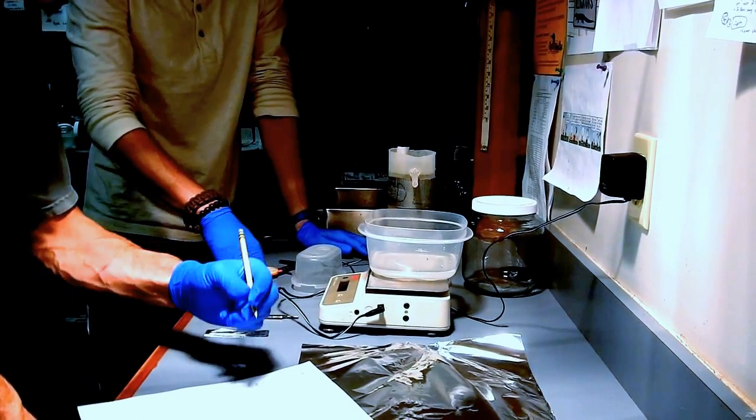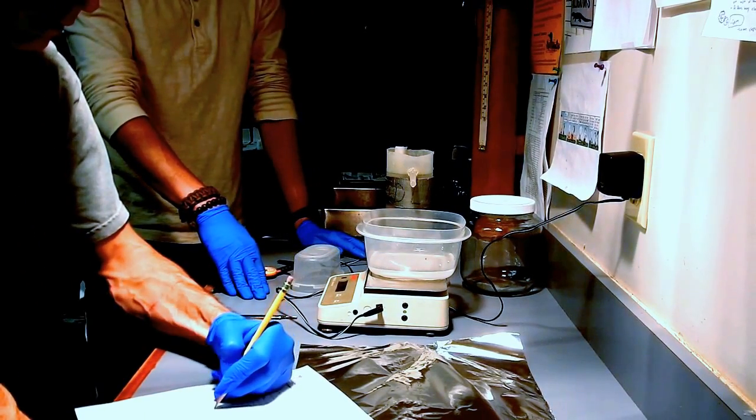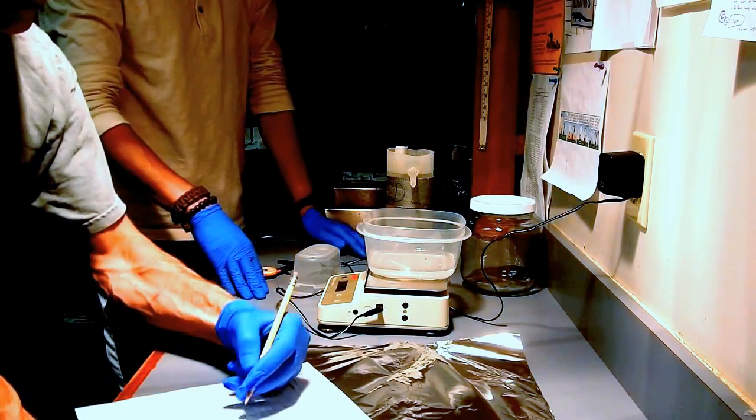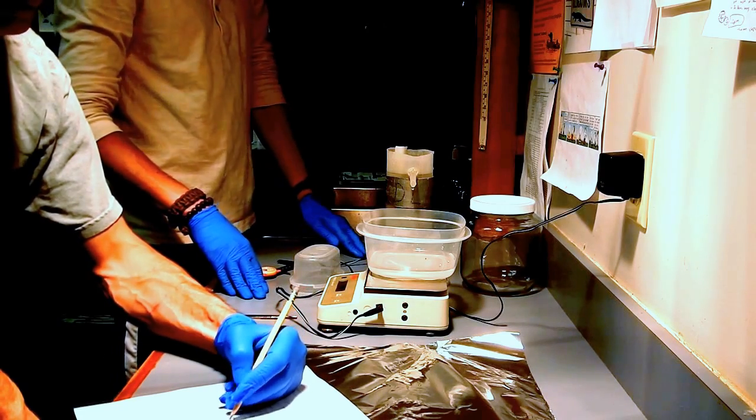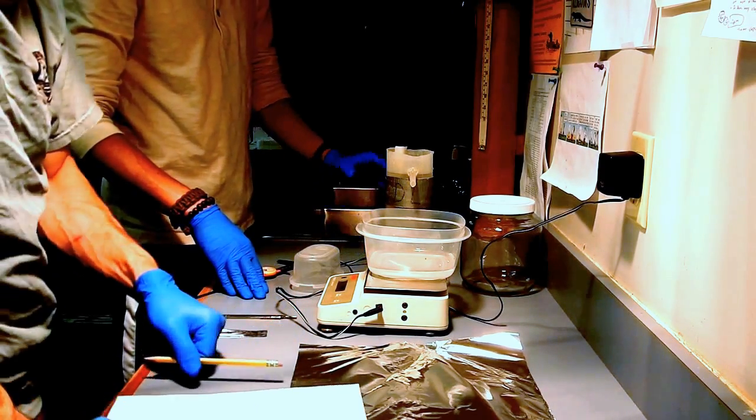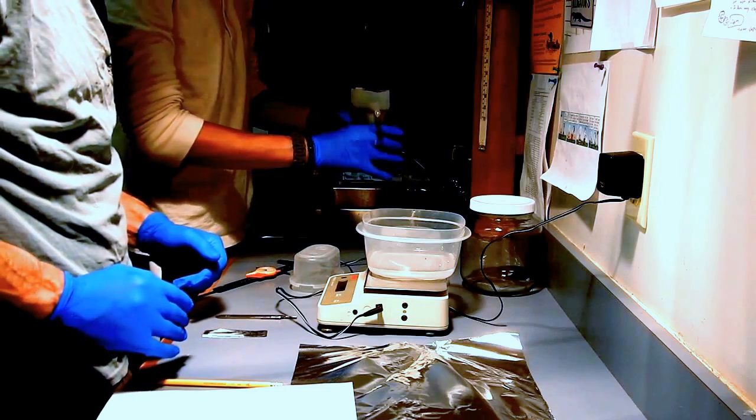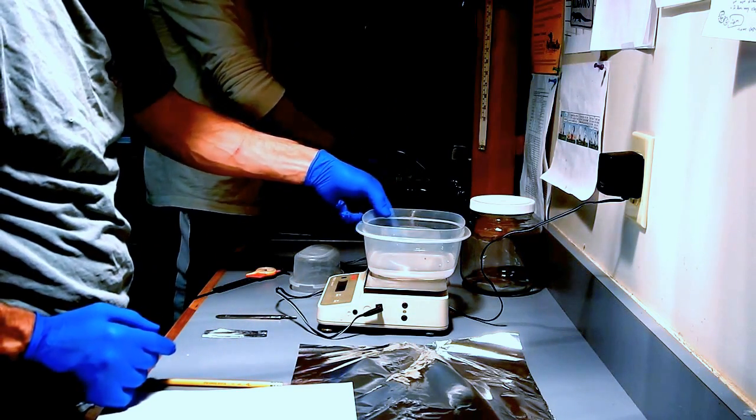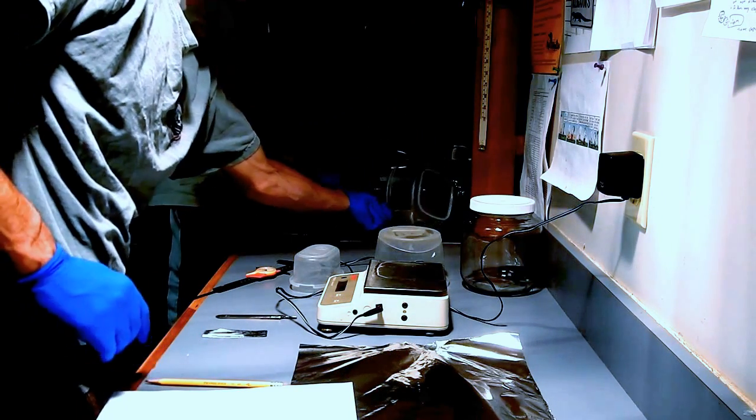164 maybe? Yeah, that's 164 milliliters of water as the volume by displacement. So, pull this out, grab the egg. I'm going to pull that out.